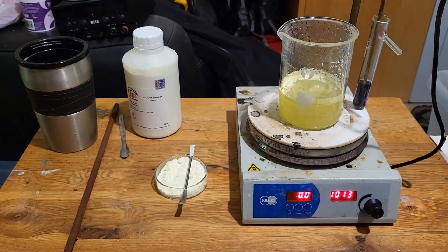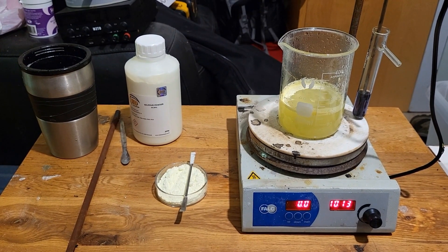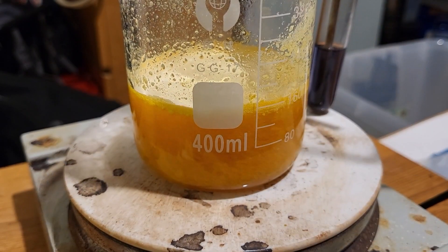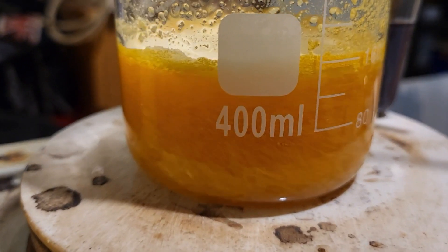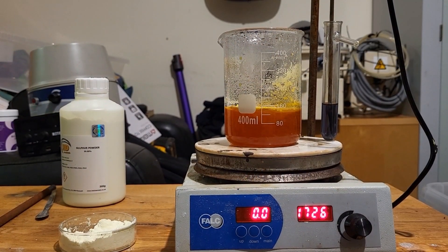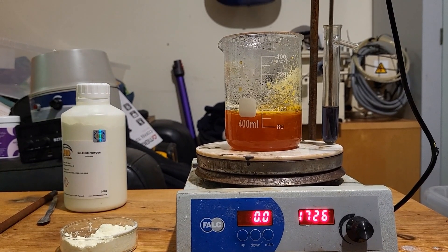I've moved inside to get out of the rain. This is still warming up. When it boils, I can start adding the rest of the sulfur. Still not quite hot enough. With this stoichiometry, sodium sulfide should be the favoured product.